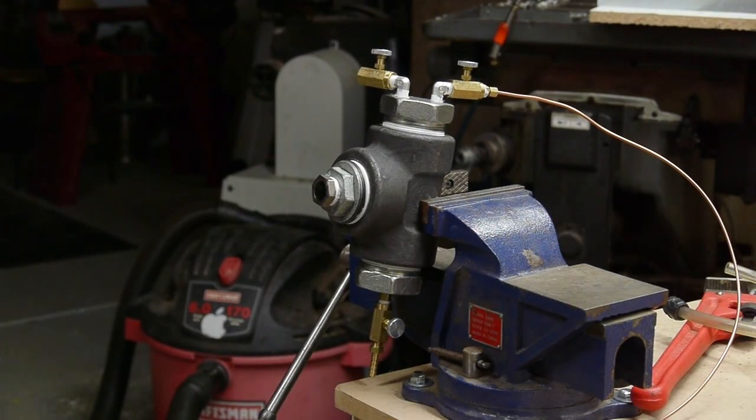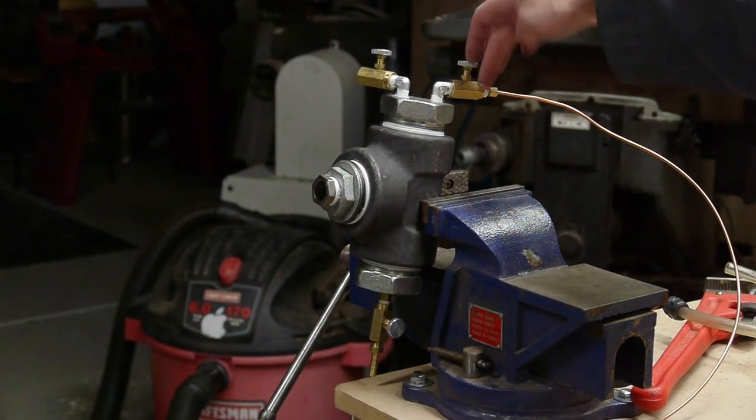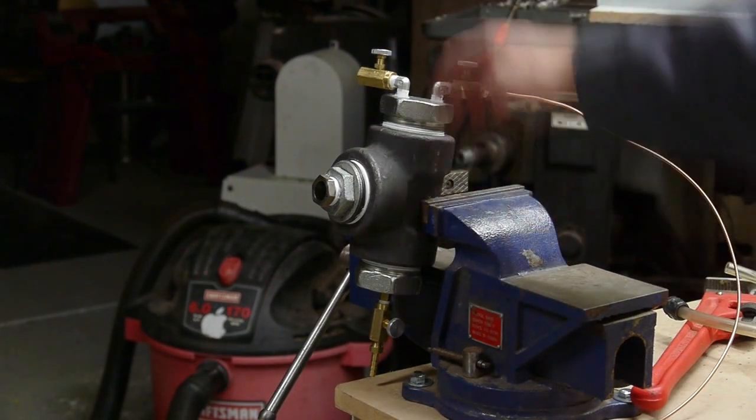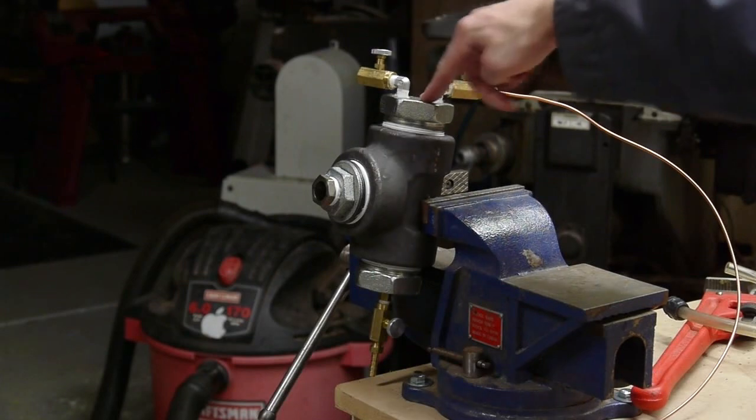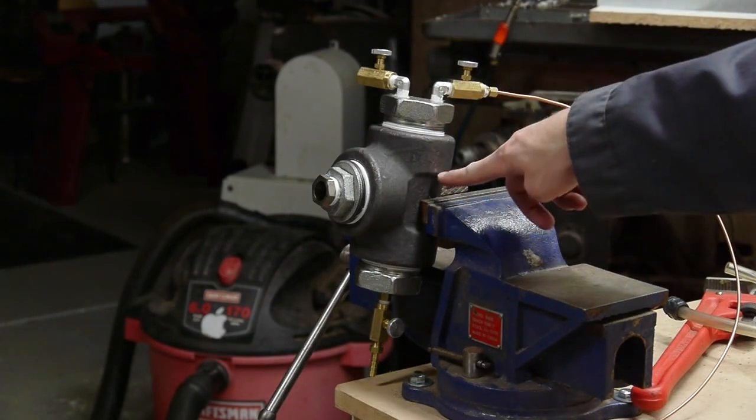By opening this valve over here, the far valve, and this one, the chamber will fill with liquid. This valve lets out the gas that's in the chamber, and this valve lets in the liquid.